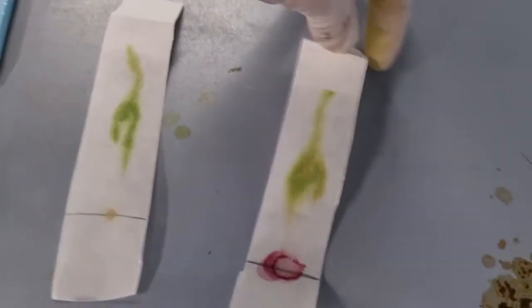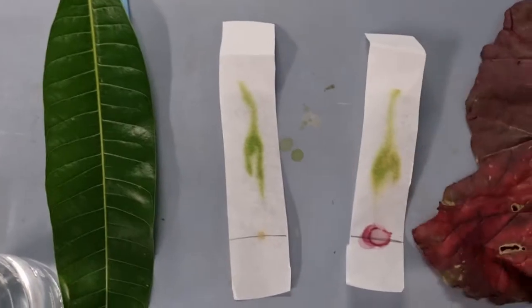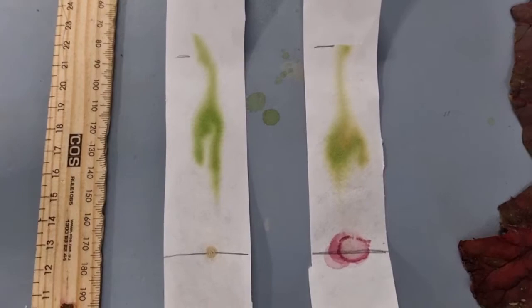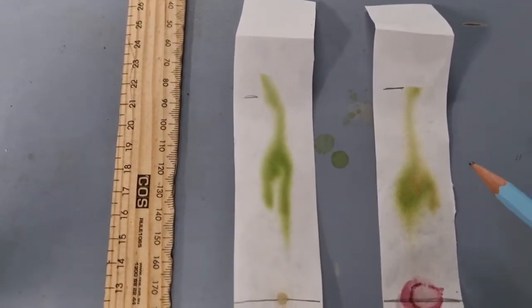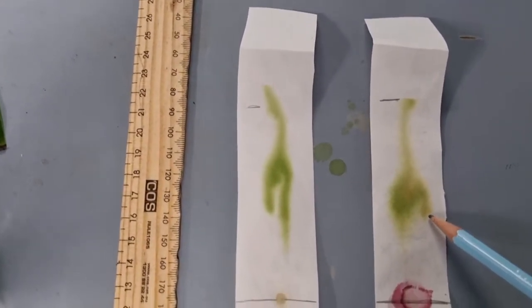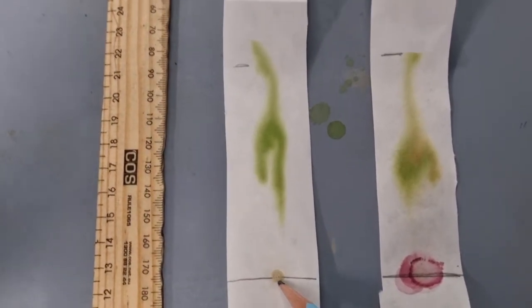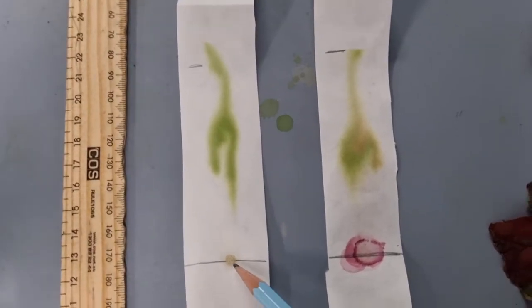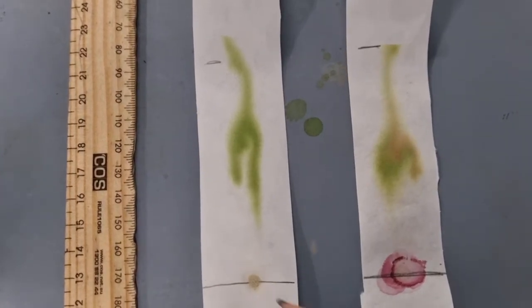Alright, so just so we know, we have the green leaf there, and then we have the red leaf there. But I think we'll just look at them in a bit of a, I guess, qualitative way. So we're just going to look for the different pigments that are here. So I can absolutely see we've got a yellow pigment traveling up here. We've definitely got the red. Arguably there might be some anthocyanin down here, but I think that's probably just, don't know, it could be a little bit red, so it is possible.